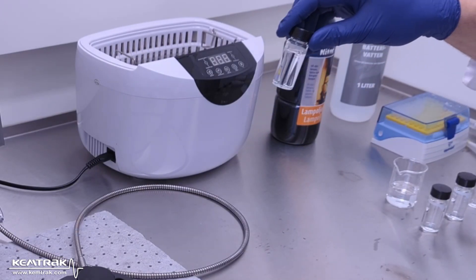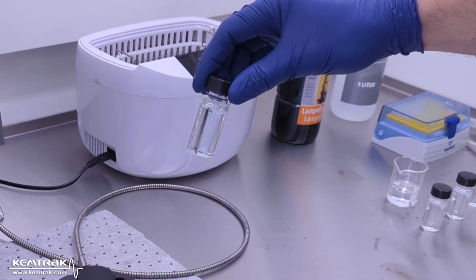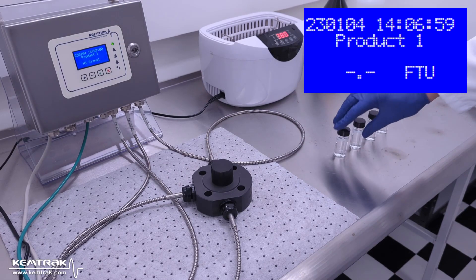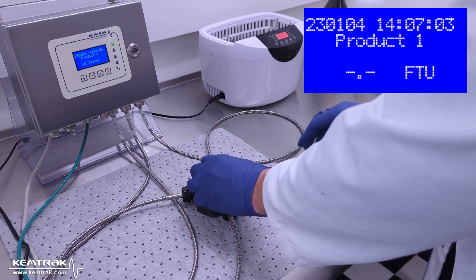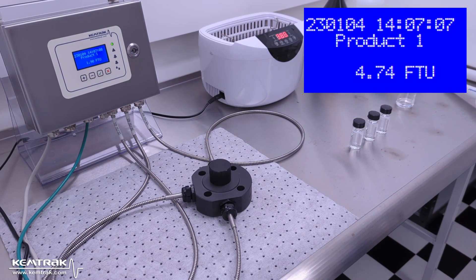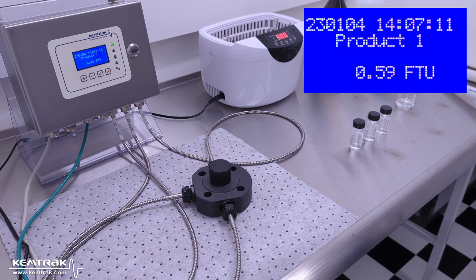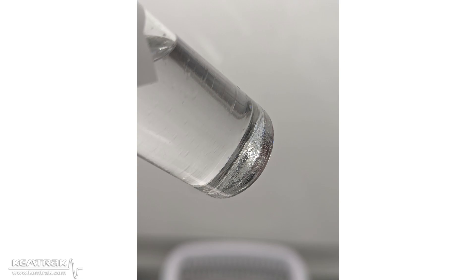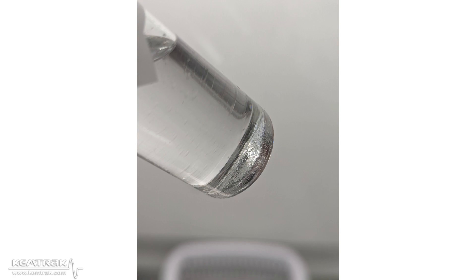You can see the water sticking to the inside wall and not dissolving. I shake to disperse and measure the turbidity. It is clear that the value goes to zero almost instantly. If you shake, there is not enough energy to disperse the water and it sticks to the glass walls.